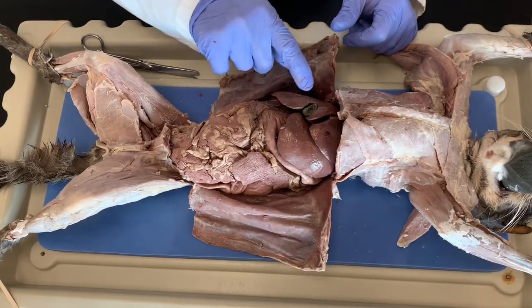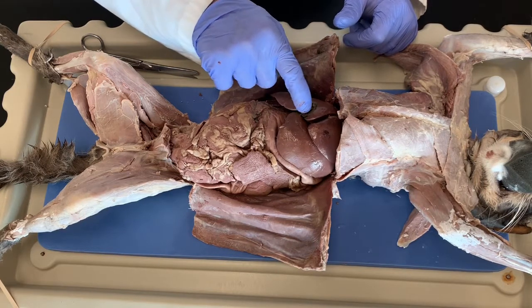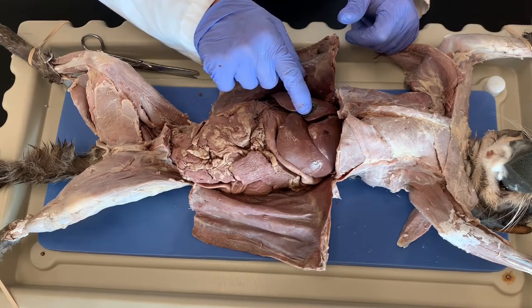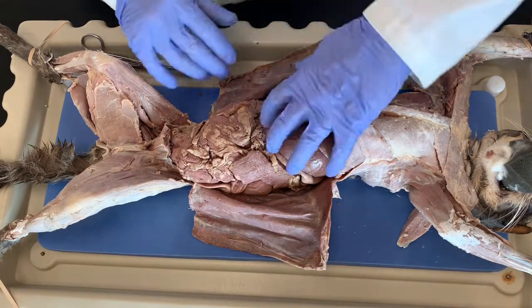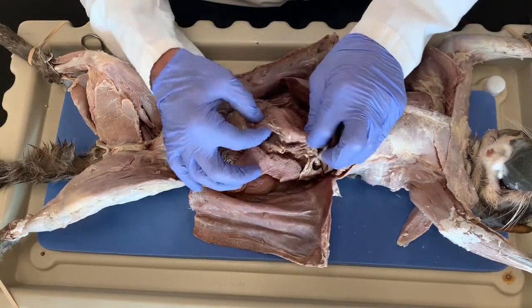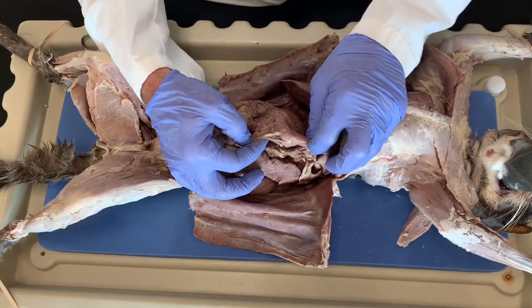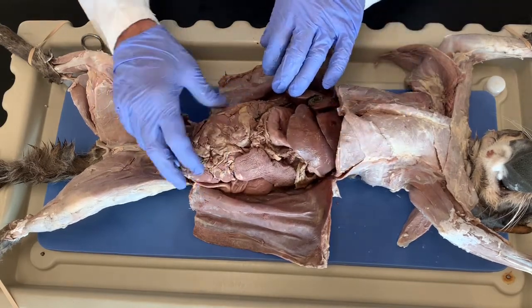The liver actually makes the bile, the gallbladder stores the bile, and then it goes from here in a passageway called the bile duct all the way to the intestines where it breaks up the fat. Okay, if I lift this up, you can see this is the stomach, okay? And attached to the stomach is the greater omentum. And the omentum is the packing peanuts for the abdominal cavity.